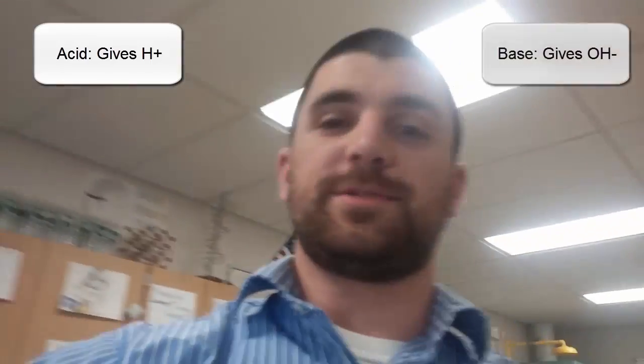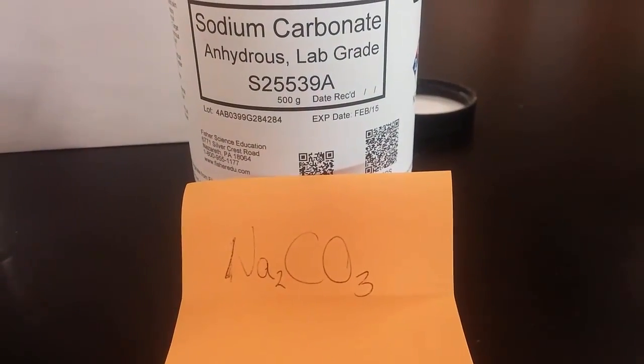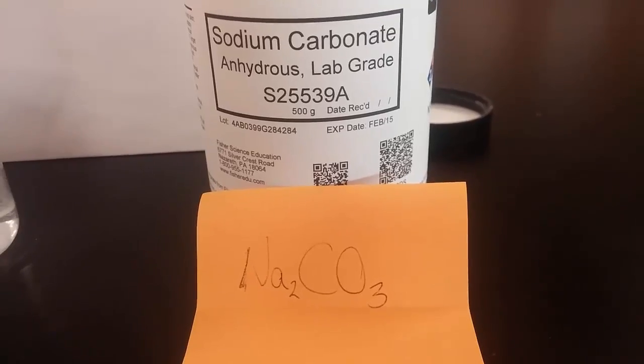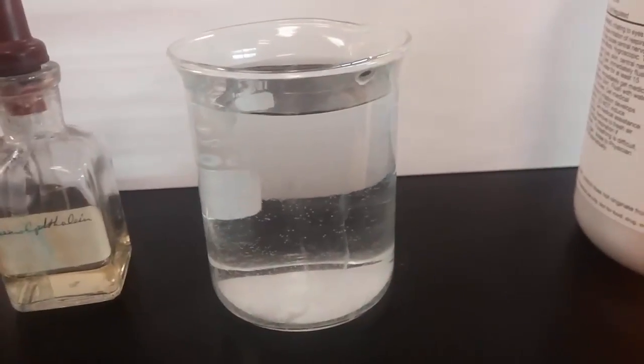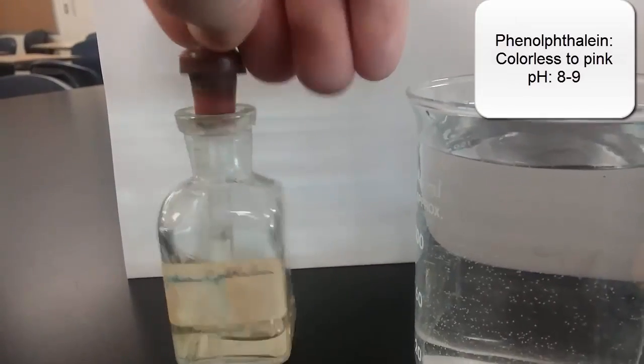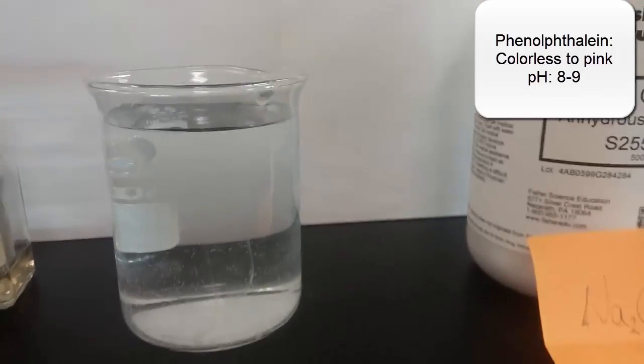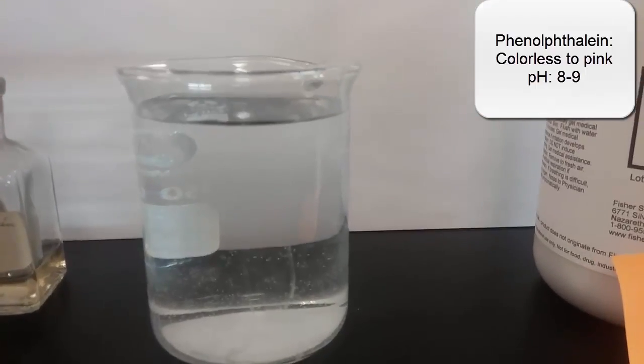So I know we've been talking about acids and bases in class, and I've been saying an acid is an H plus donor and a base gives off an OH minus, but I want to show you something. Here I have some sodium carbonate, which has the formula Na2CO3, so it doesn't have any H plus to give, nor does it have an OH minus to give. I've got some water right here, and I've got some phenolphthalein, which you should be familiar with. It's an acid-base indicator, and you can see when I put it into the water it is clear, because the water is neutral, and phenolphthalein is colorless in a neutral solution.